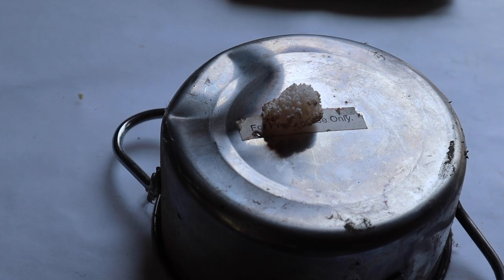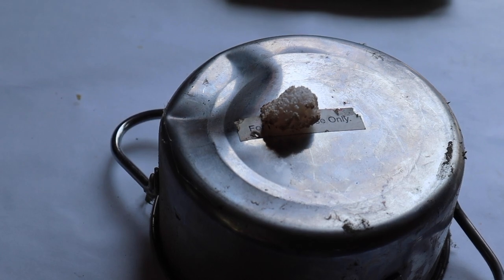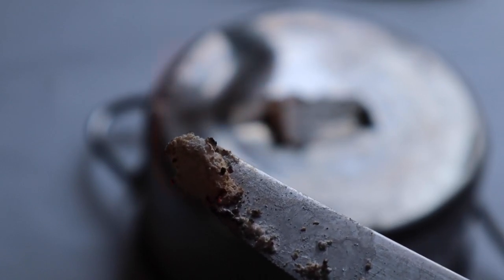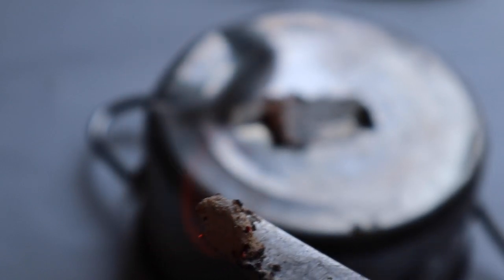I can hardly see it. I guarantee you won't be able to pick it up on camera. If you use ethanol, it'll be much more noticeable. This is on fire right now. You can barely see the flame, but you see that little white crusty stuff. That's calcium carbonate.